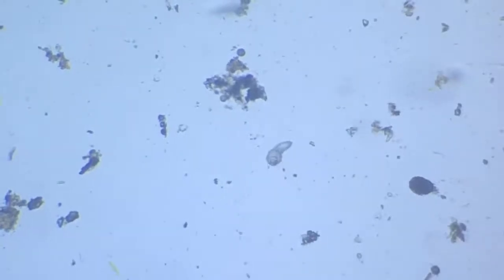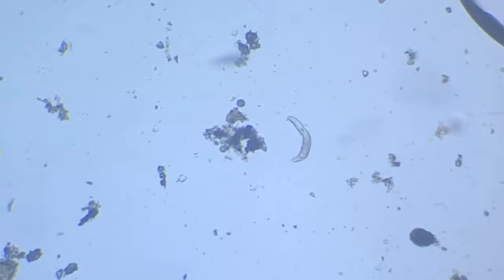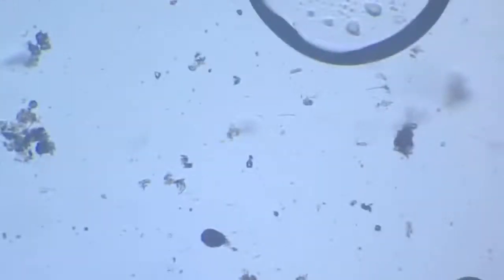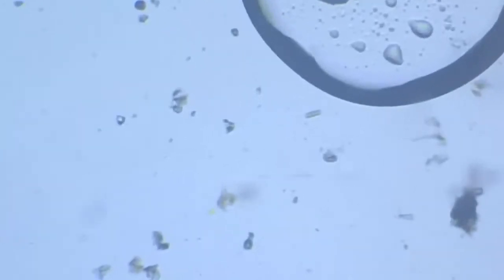Now, who is he? Who is this? Free floater. Could be a rotifer. I think it is a rotifer. And who is he? Who are you?